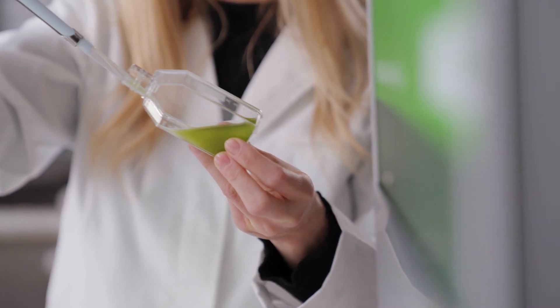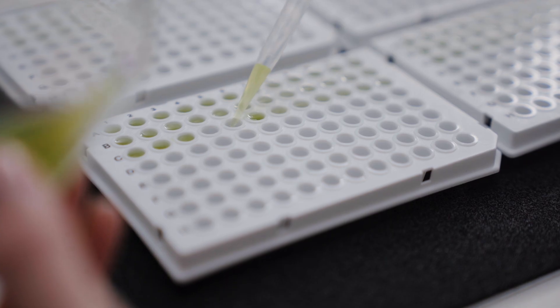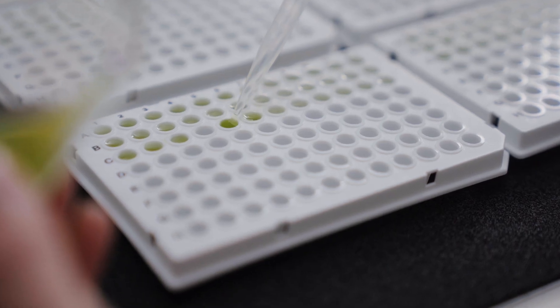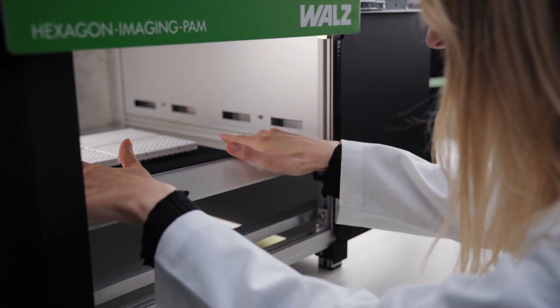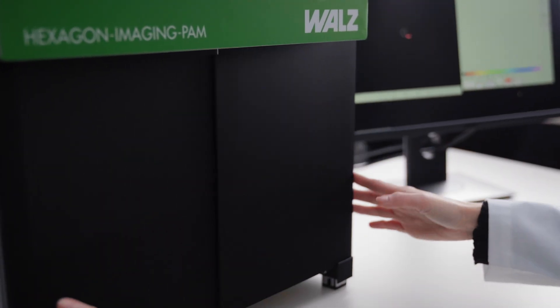A variety of samples can be measured – algae, mosses, or higher plants, potted in culture flasks or multi-well plates. Samples can also be measured through a transparent lid if they need to be kept sterile.